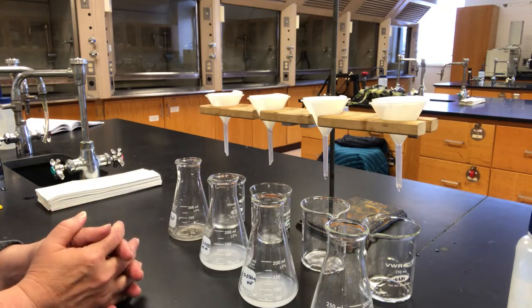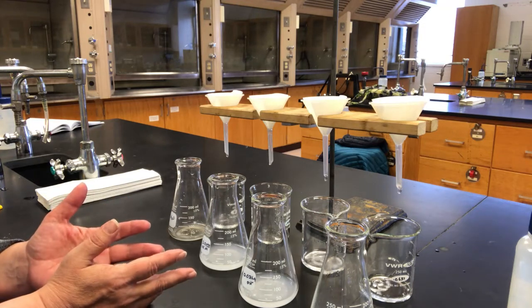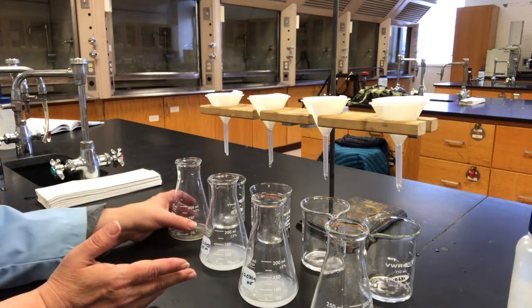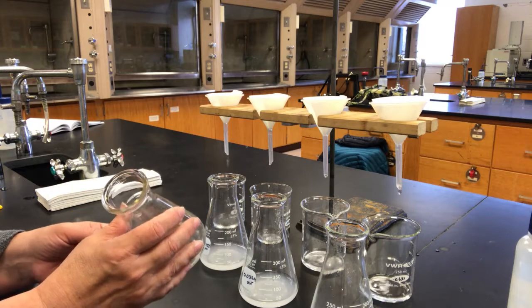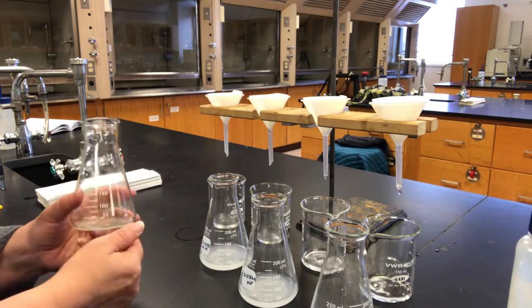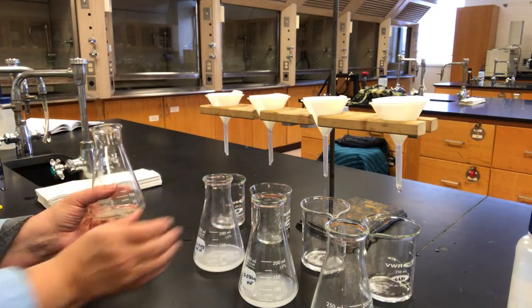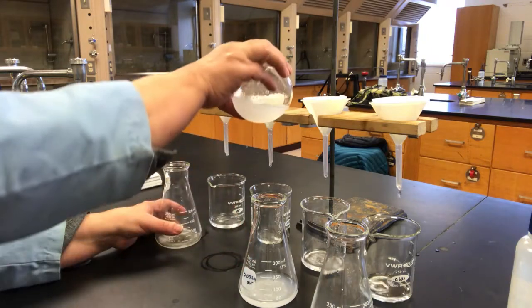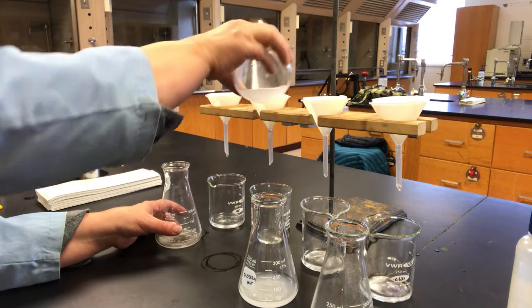What's nice about this is that I just have to find the concentrations in each one, so it's not super careful in terms of making sure everything's transferred perfectly. I don't have to worry about transferring the solid that remains in the Erlenmeyer flask into the beaker, because I don't care about that. I just care about the concentration of the substance that's dissolved in the solution itself. So it doesn't matter how much is left behind.